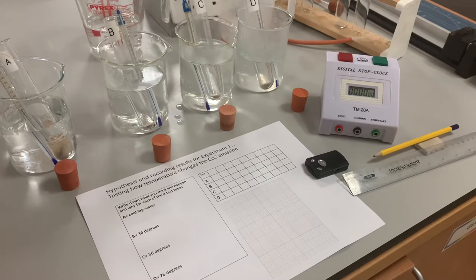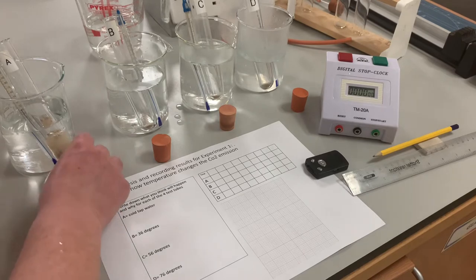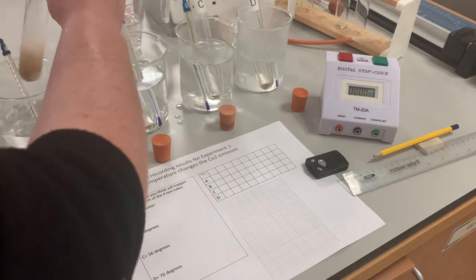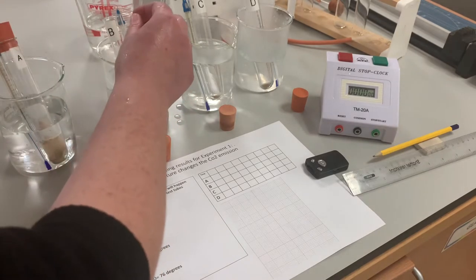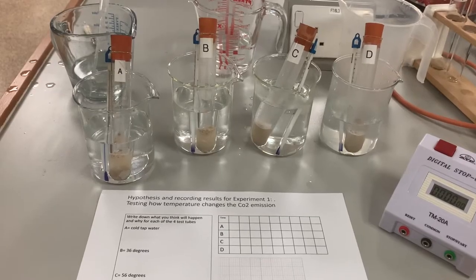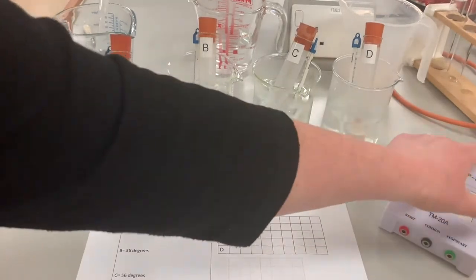I'm going to put four pipettes of water in each one of the tubes, make sure it's well mixed, and then once they're all established, I'm going to time the first five minutes.